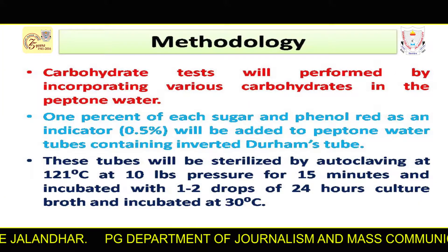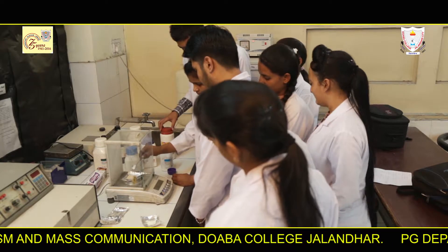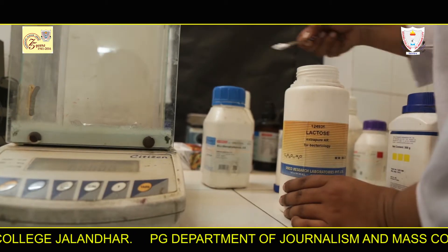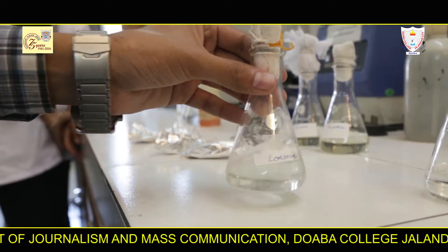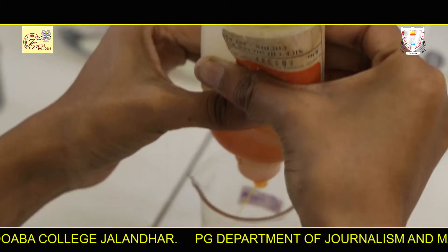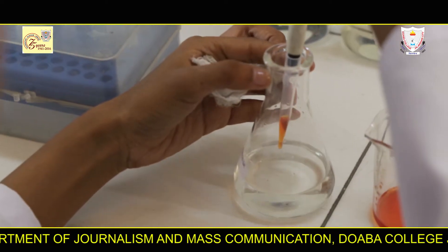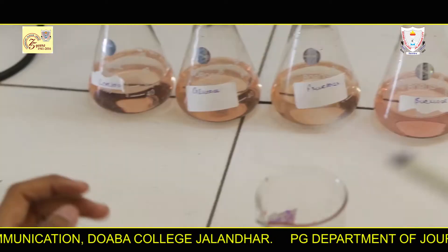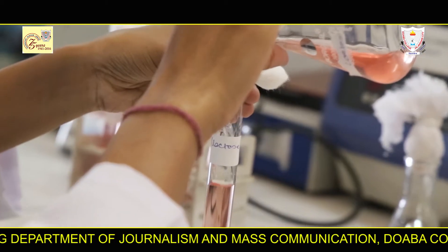Now we study how to perform this test in the lab. Carbohydrate tests are performed by incorporating various carbohydrates in the peptone water. These carbohydrates are glucose, fructose, lactose, and sucrose. 0.5% phenol red is mixed as an indicator with 1% of each sugar — glucose, fructose, lactose, and sucrose. This mixture is then added to peptone water tubes.